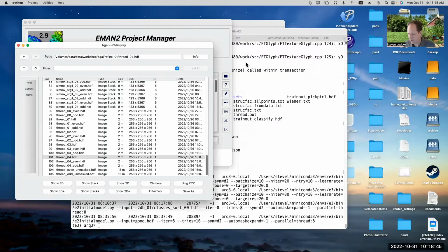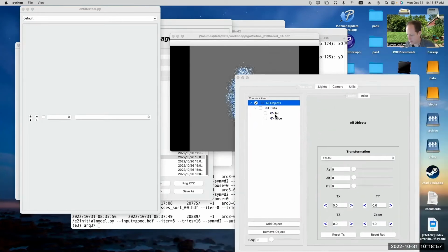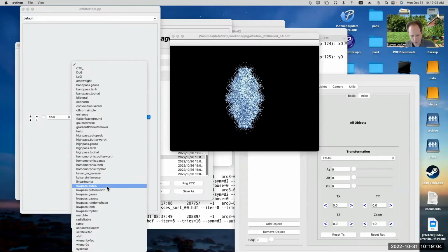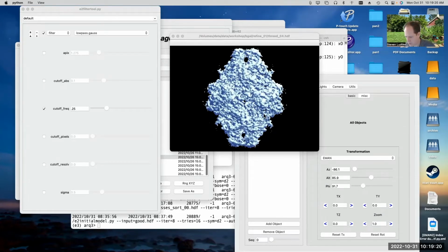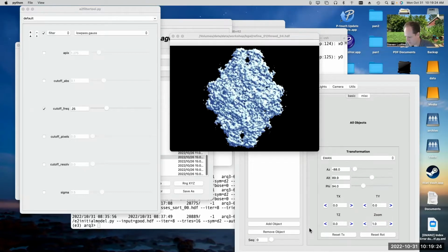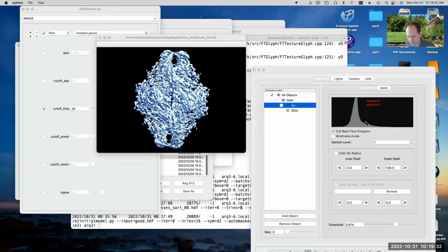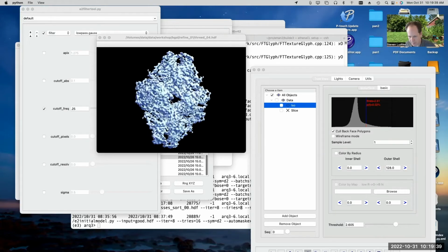Actually, we can just do a little bit of a global filter on it. Let's go ahead and launch filter tool on this, and we can play with the filter. Turn off the slice, and I'm going to say filter low pass Gauss. Cutoff frequency. Let's filter it to say 4 angstroms. Okay, so now that's been filtered to 4 angstrom resolution. You can see it got rid of a lot of that funny noise outside, and just visibly, it's a lot easier to see a lot of those features now. If I adjust the isosurface threshold a little bit, we'll pretty much get rid of all that noise. And we've gotten rid of a few of the details which are real, but it's a lot more pleasant to look at this way.